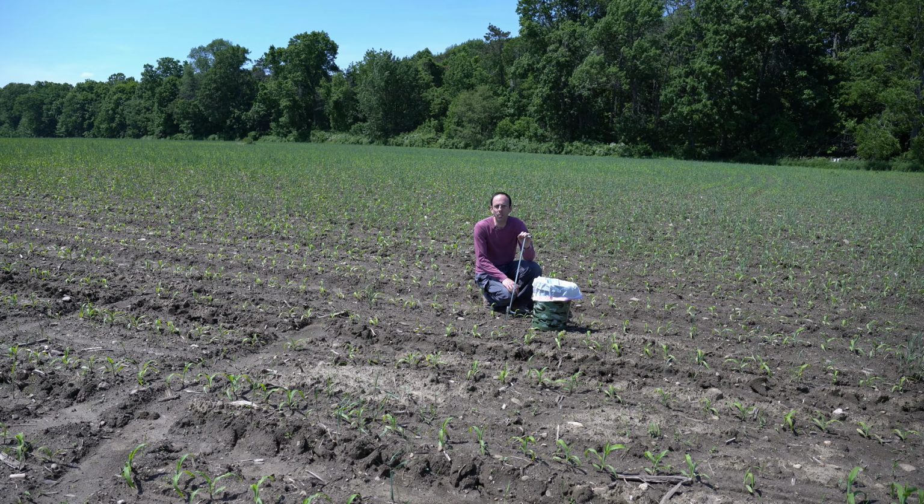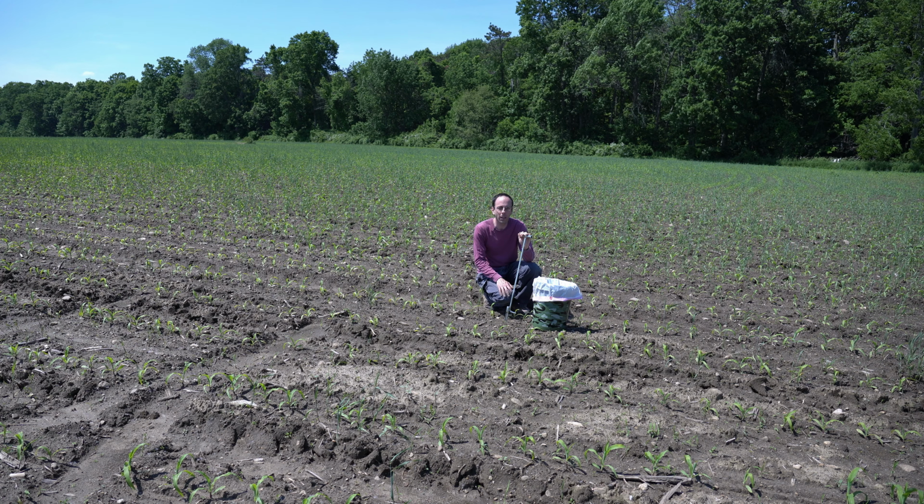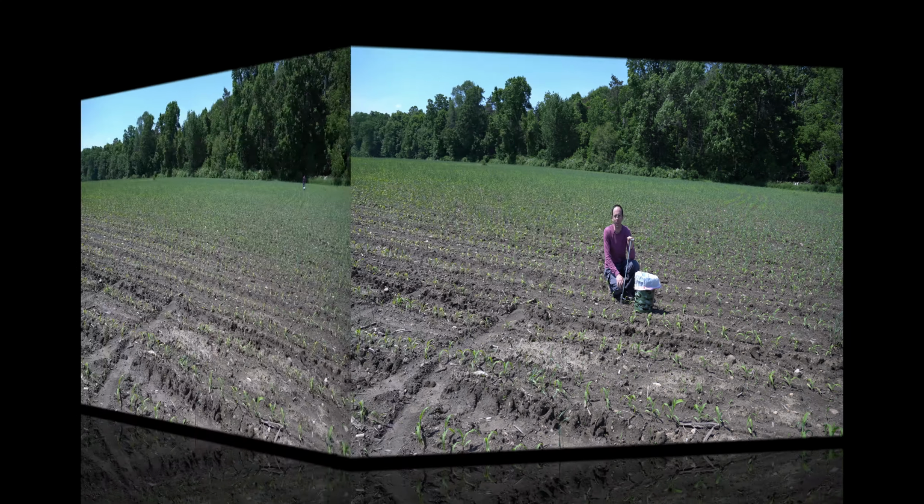All right, so we're going to use this field as a representative field for taking soil samples. When we look at the field overall, we don't see any major really low spots or any dips, so we can do just a normal random sampling. So this here is going to be my first point to randomly sample. And let's see where else I would sample this particular field.